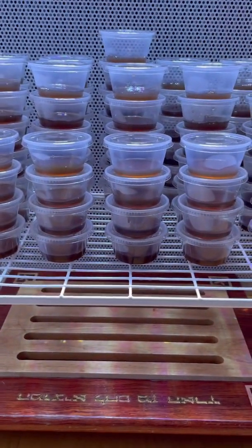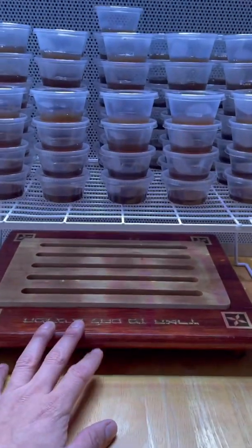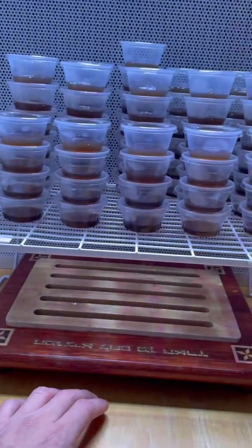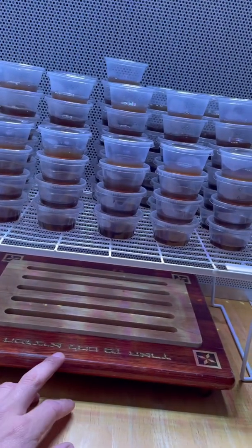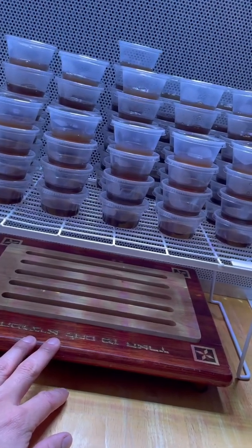I'm just trying to figure out a recipe that I could stick with and not play around with agar that much. I did play around with agar last year, learning oatmeal agar and all that. And I learned a lot, trust me. You get better at pouring these things.